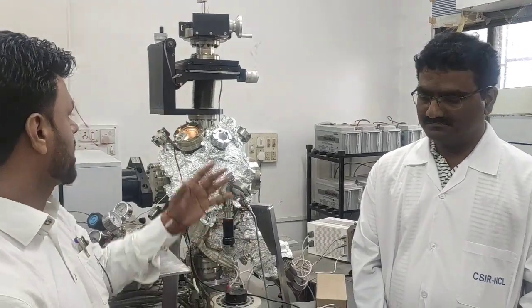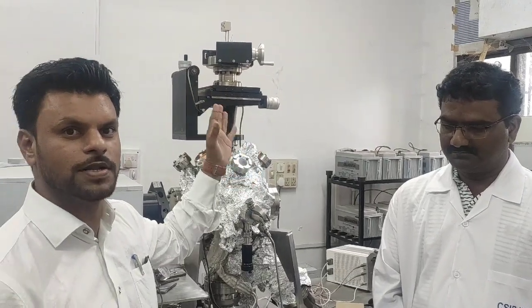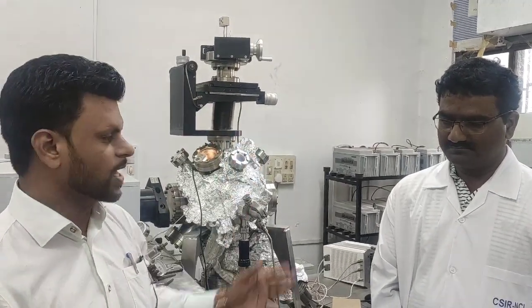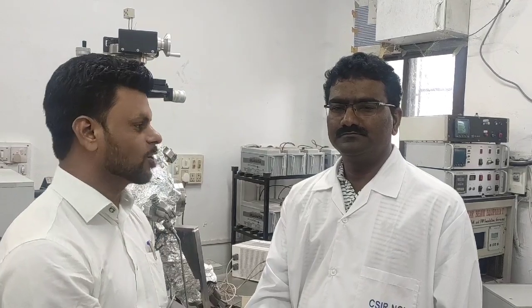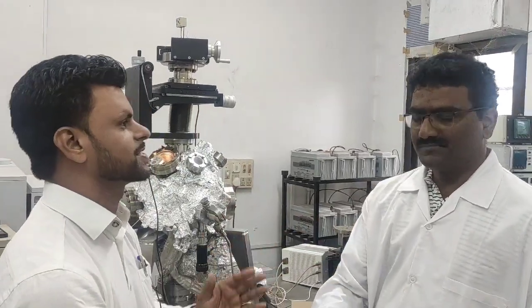Hello guys, myself Dr. Atul Nagpure, and right now I am at CSIR-National Chemical Laboratory Pune. The instrument you are watching behind me is called a molecular beam instrument, and with me we have Dr. Sadhu, scientist at CSIR-NCL Pune. Now I humbly request Dr. Sadhu sir to introduce himself as well as highlight the importance of the molecular beam technique. Yes sir, please go ahead.